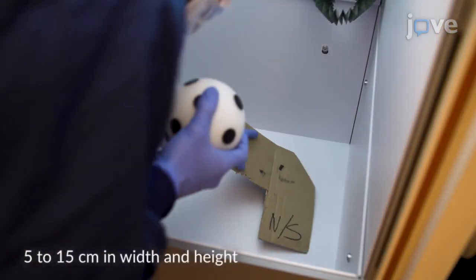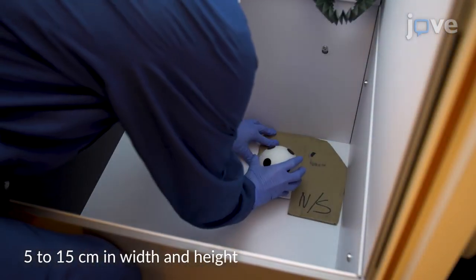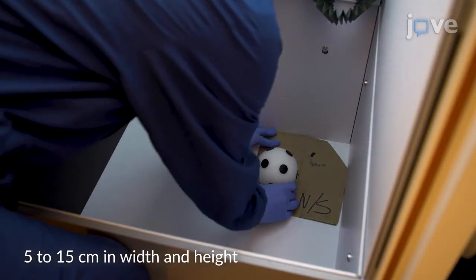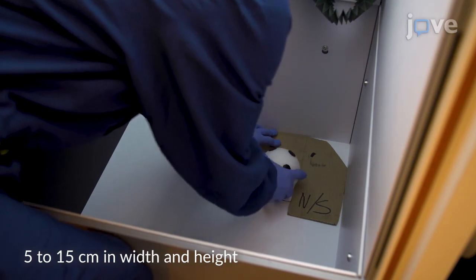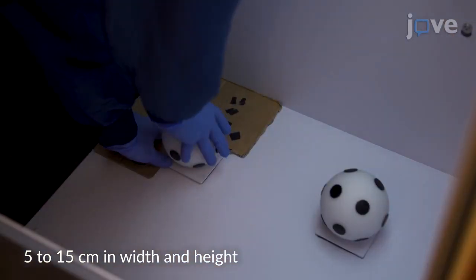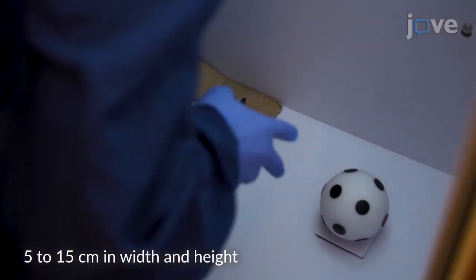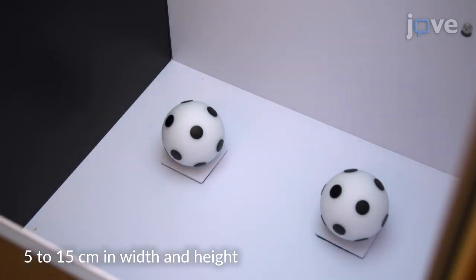Attach different pairs of objects that are non-porous, non-chewable, and easy to clean, with distinct geometric shapes and textures, to the floor of the arena.